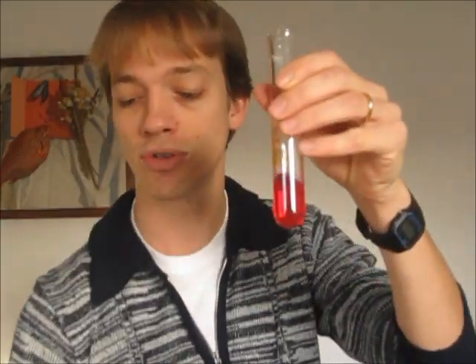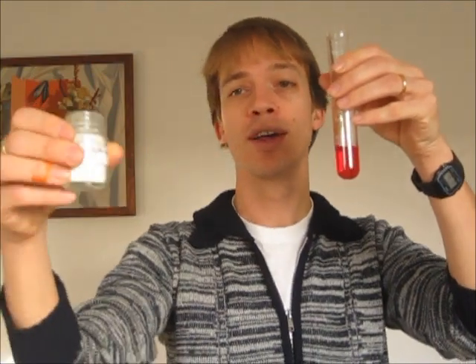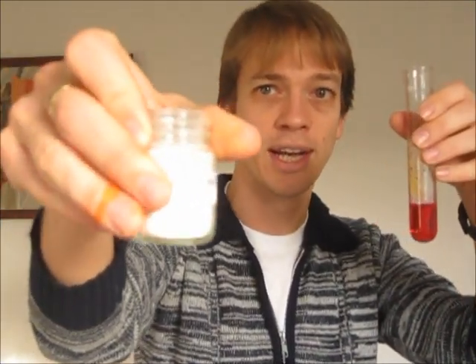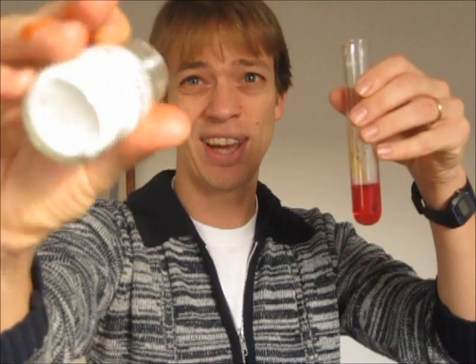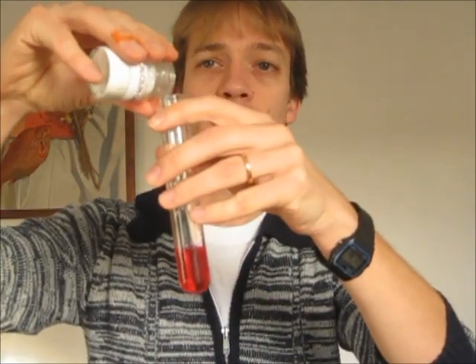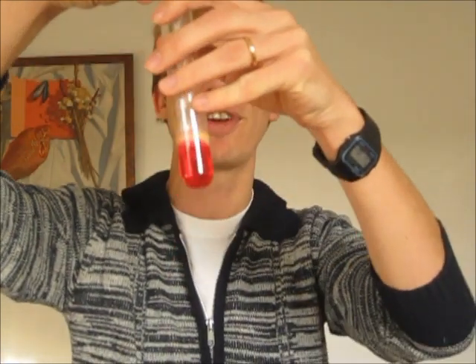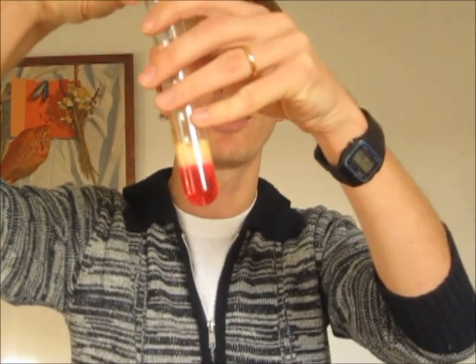I'm now going to neutralise it using a carbonate — calcium carbonate. It's white chalky stuff; it's basically ground-up limestone, ground-up chalk. I'm going to add some in here and let's see what happens. It goes fizzy, and it's turning a different colour.